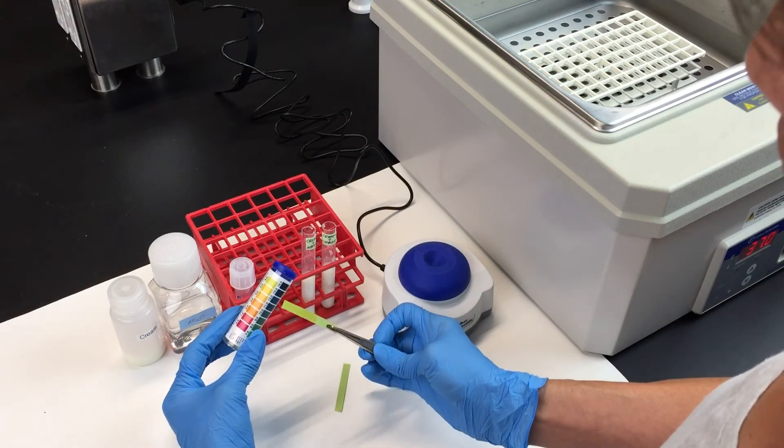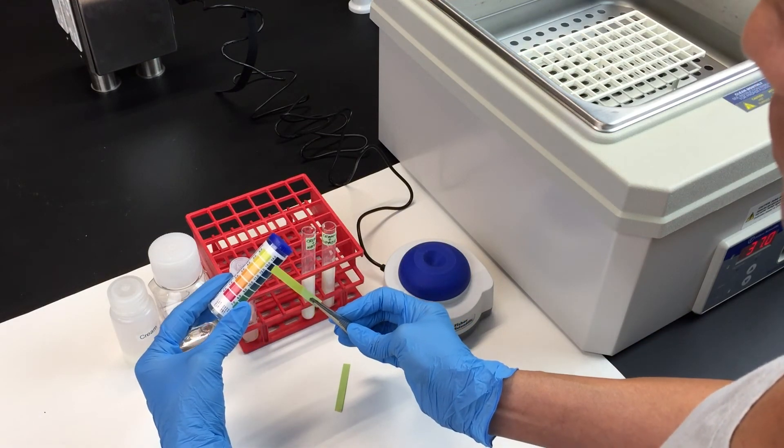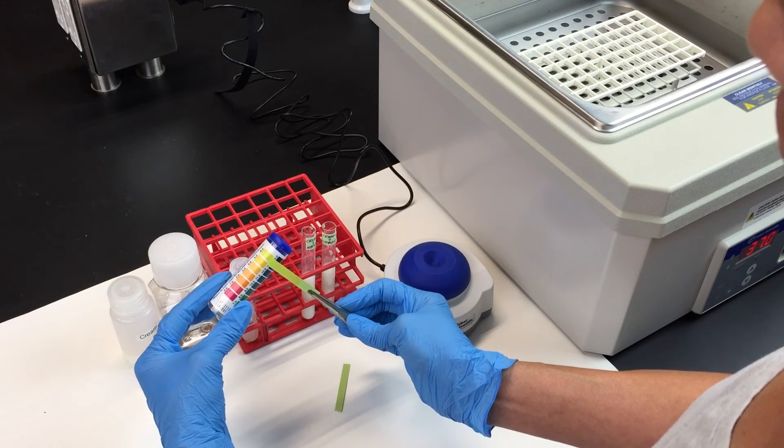Make sure you write down the pH right away because the color will change as it dries out.